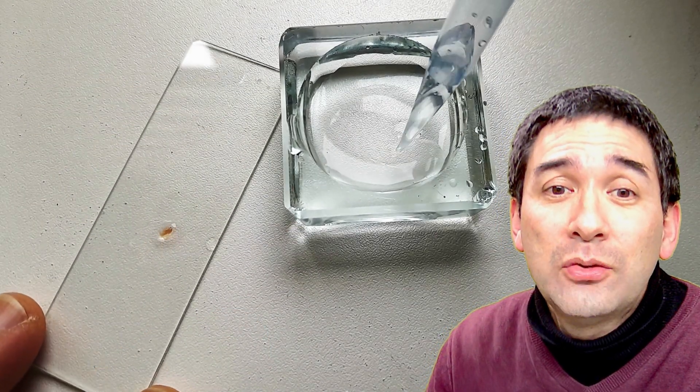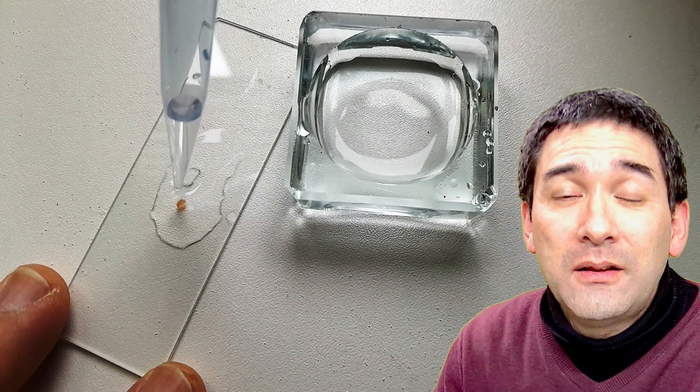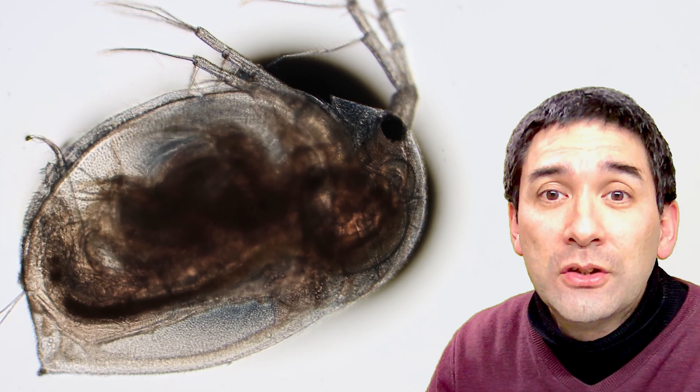And then when I added it to the Daphnia, then I quickly had to put it under the microscope so that the effect of the alcohol could be seen right away.